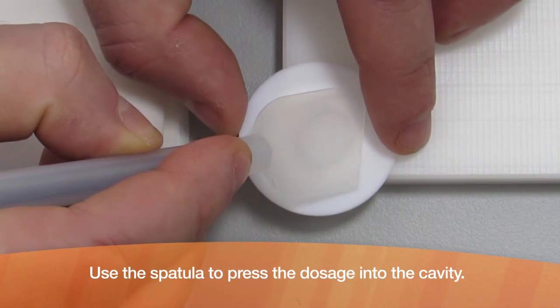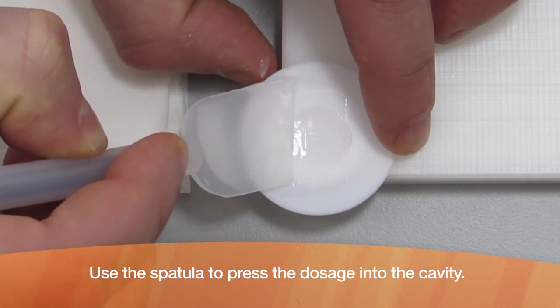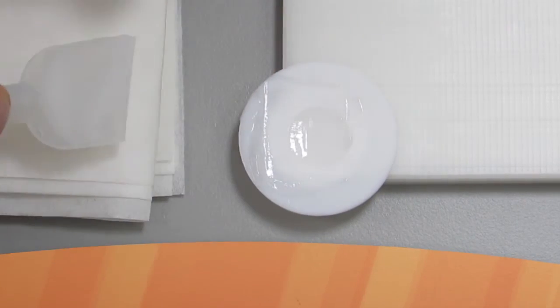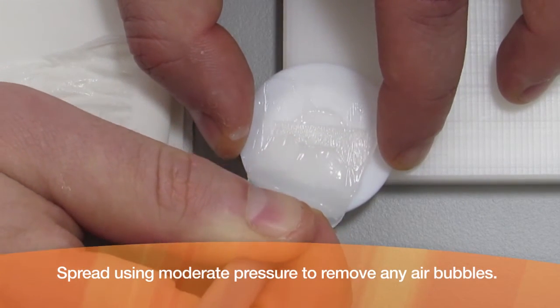Apply the dosage. Use the spatula to press the dosage into the cavity. Spread using moderate pressure to remove any air bubbles.